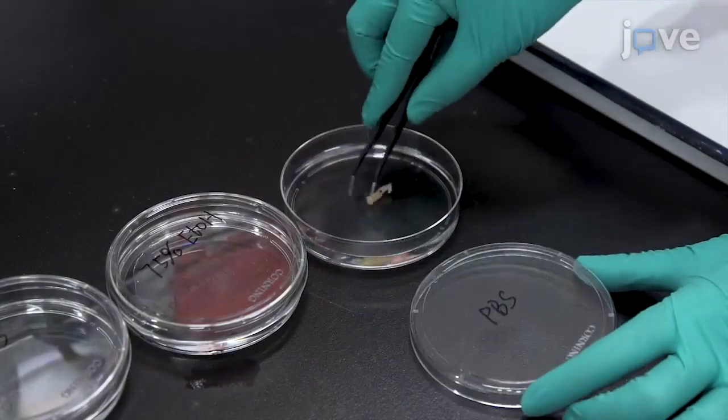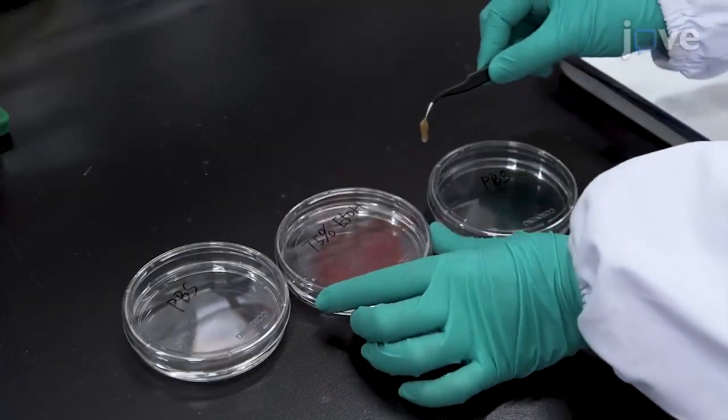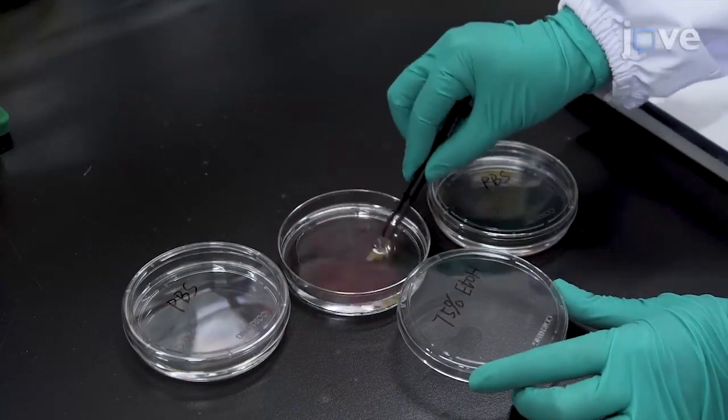Wash the tissue samples in PBS twice and disinfect them by immersion in a 75% ethanol solution for no longer than 2 seconds.